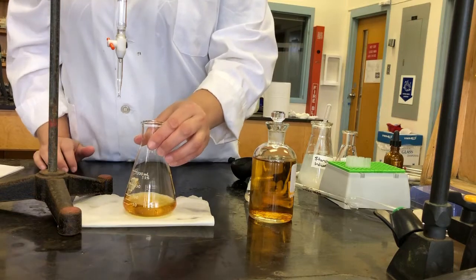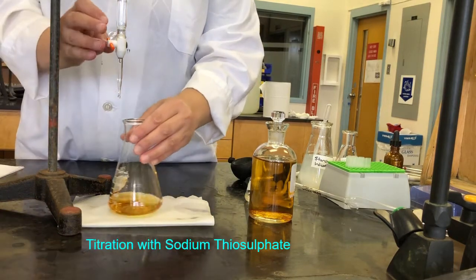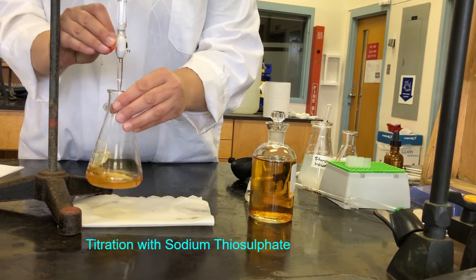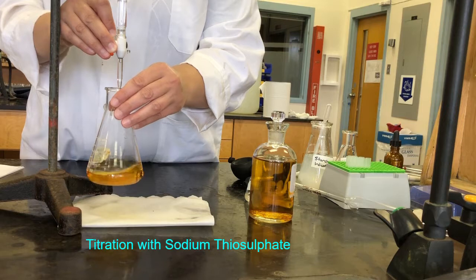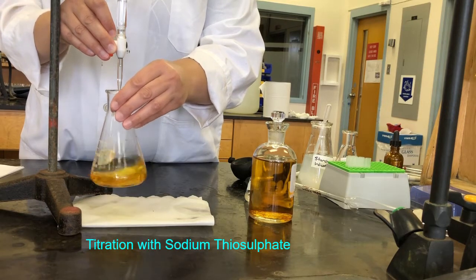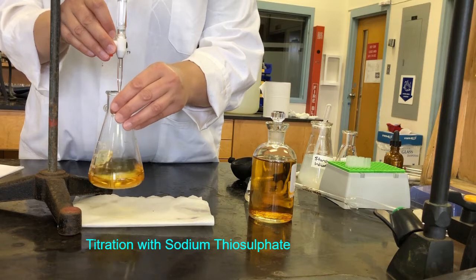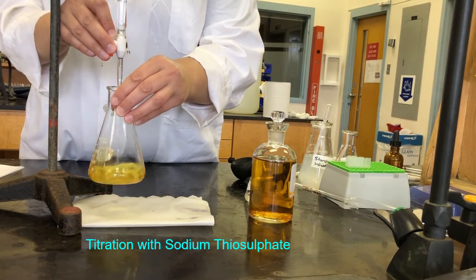Okay, so now we're ready to start our titration. So, remember, we did this previously. We're going to titrate until we have just a faint yellow color, and then we'll add the starch indicator at that point. So we've got a fairly deep yellow now.